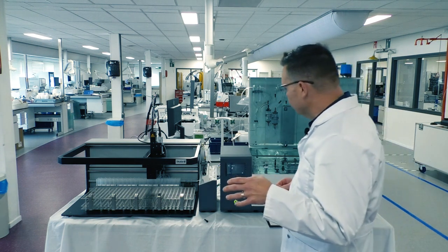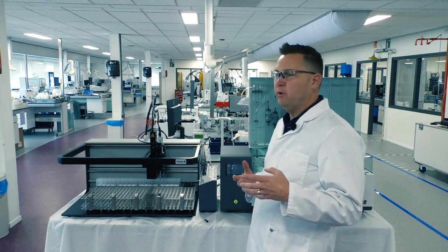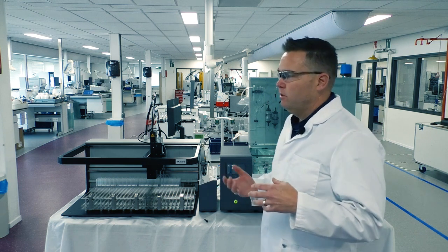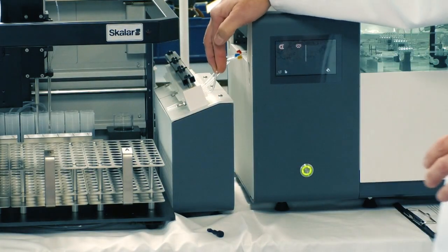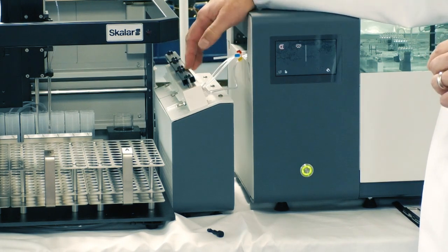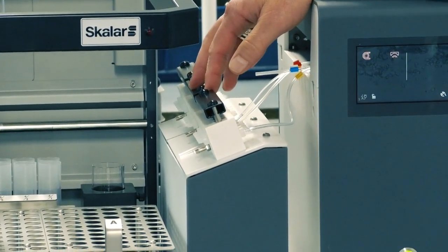So we're here on the unit, and essentially what happens is once all of our samples have been analyzed, we tell the system that we want to basically go to a shutdown mode. What that means on our system is we have a series of rinse valves that change over from all of my reagents, and you'll see the rinse valve here. They're connected to my pump tubes, so the system is still pumping its reagents. Then the valve switches over and pulls in DI water and rinses for a determined amount of time. Then once that's done, the pump will stop.